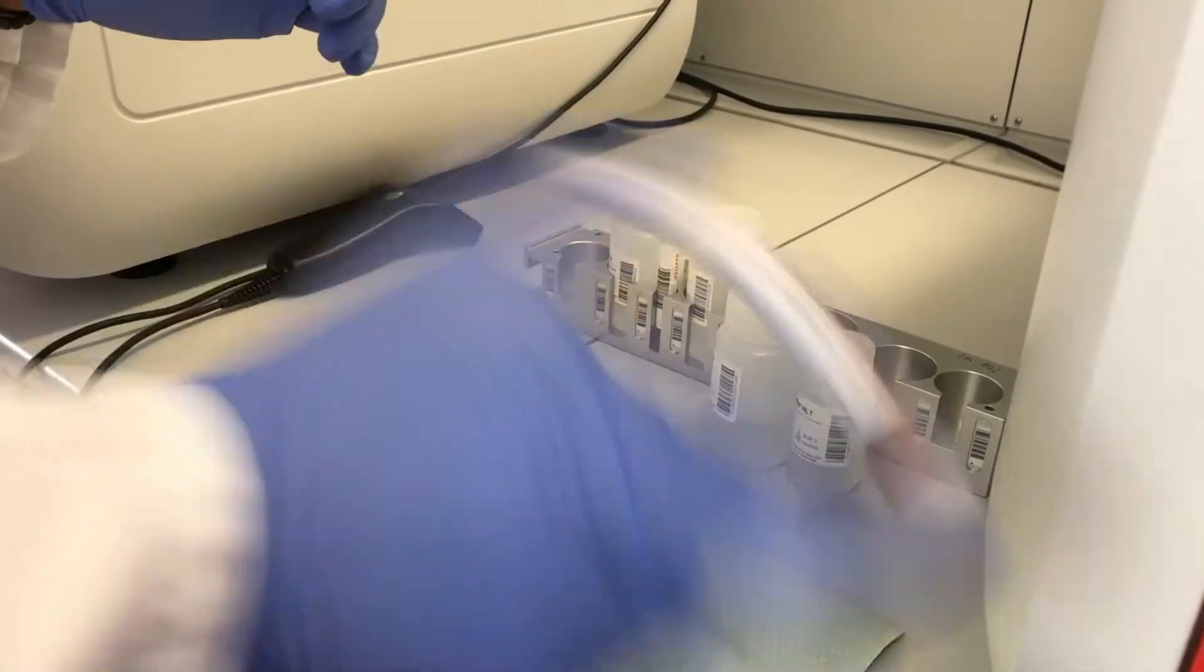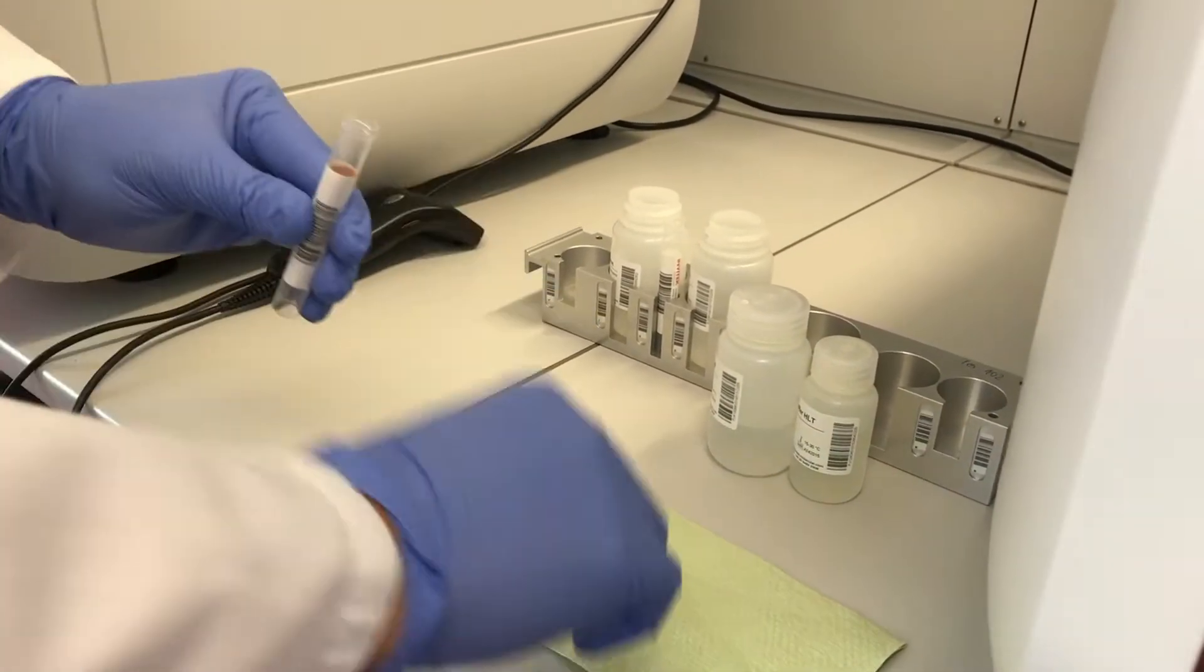Shake the magnetic beads, open all reagents of the kit and place them to the tray.